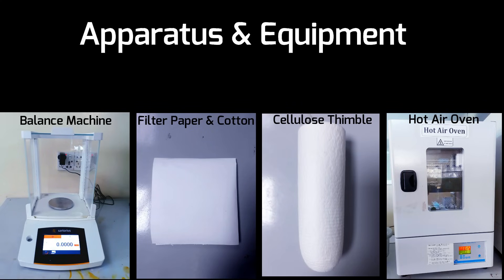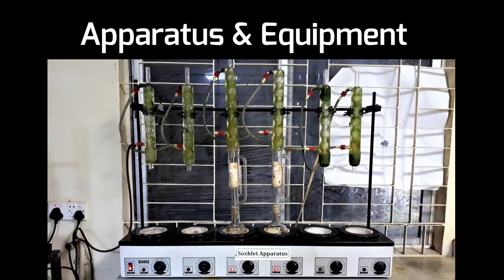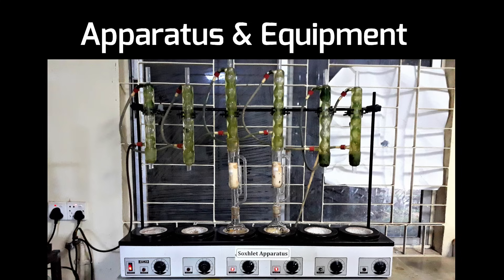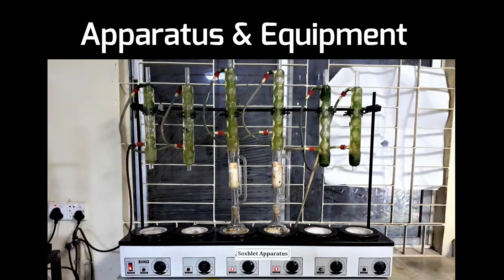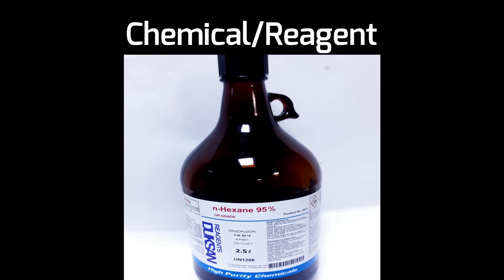To do the analysis, we need some apparatus and equipment, like a balance machine, filter paper, cotton cellulose thimble, and hot air oven. We also need the Soxhlet apparatus or Soxhlet extractor. To carry out the whole test we only need N-hexane or other anhydrous diethyl ether.